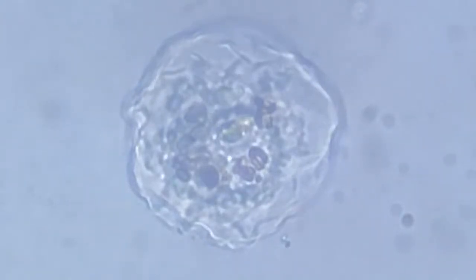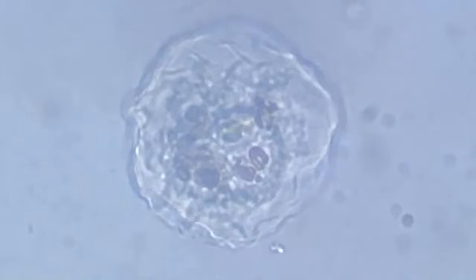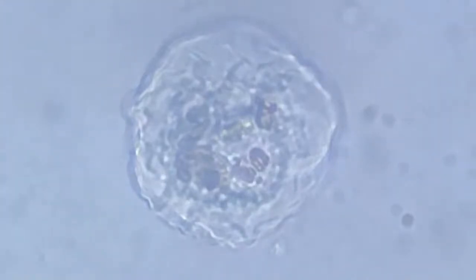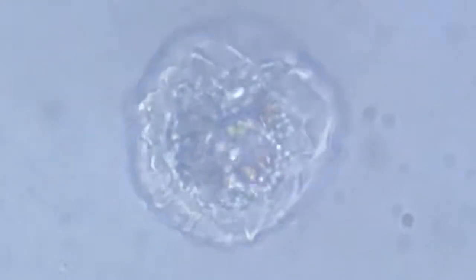I hope you can also observe the movements of the cell organelles. There you see, the 3 o'clock side pseudopodia has been preferred over the 7 o'clock side pseudopodia, and hence the shape has become more oblongated along the 3 o'clock side.